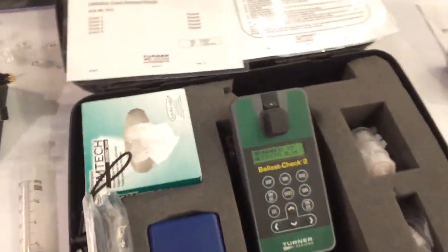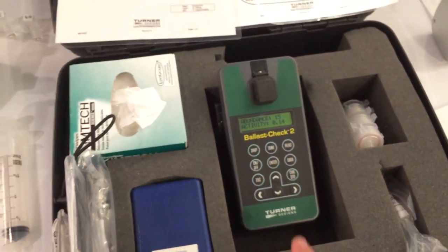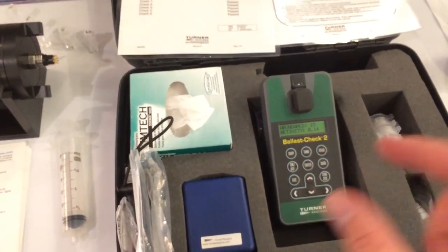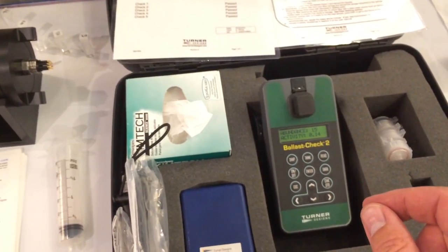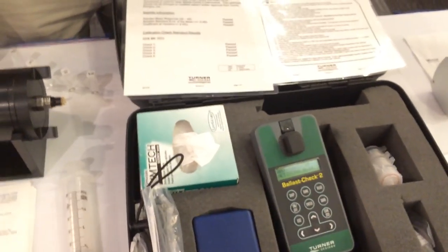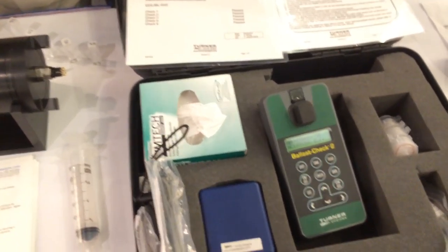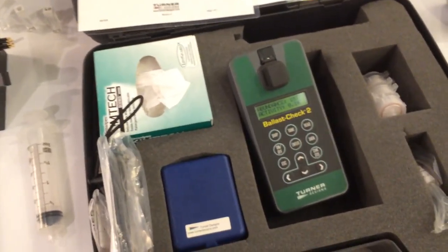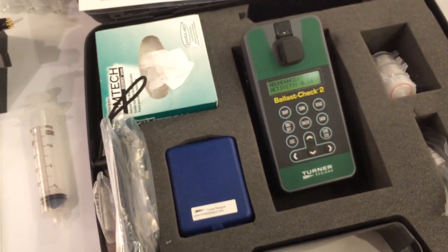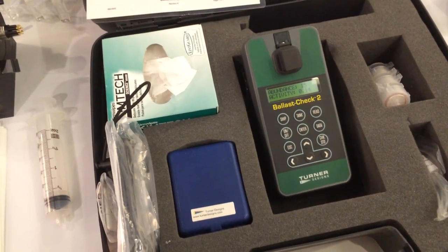So you guys are doing this now — is this just because you're trying to be good, or is there some standard you have to meet with ballast water detection? The ballast discharge standard, yes. This meets that standard. But is there some kind of certification? No, there's no certification for these things. It's about how well your instrument works to indicate whether ballast water is within compliance.